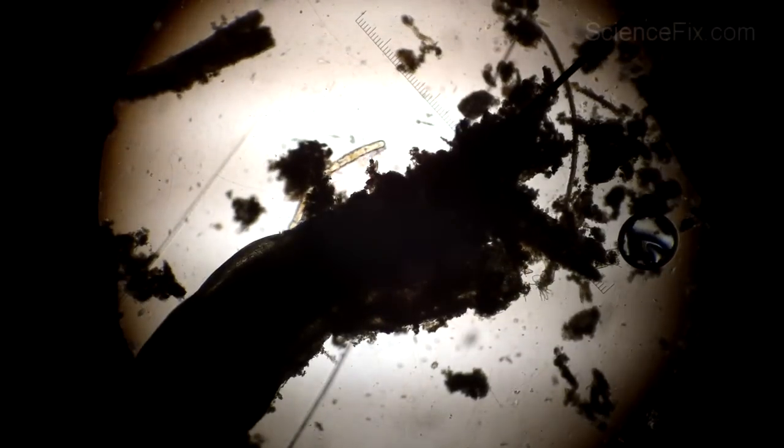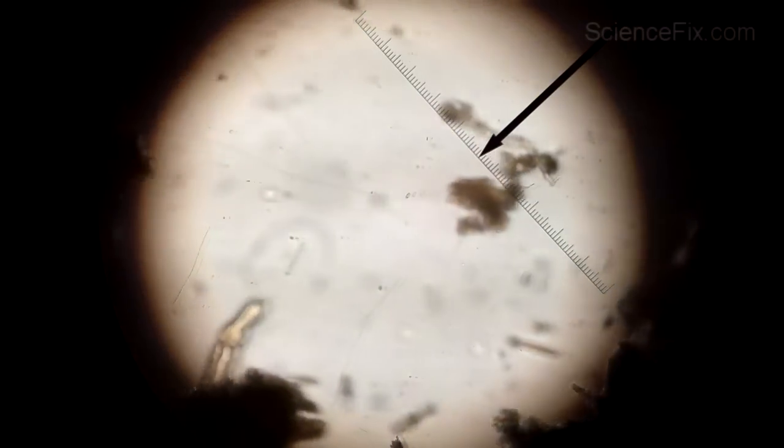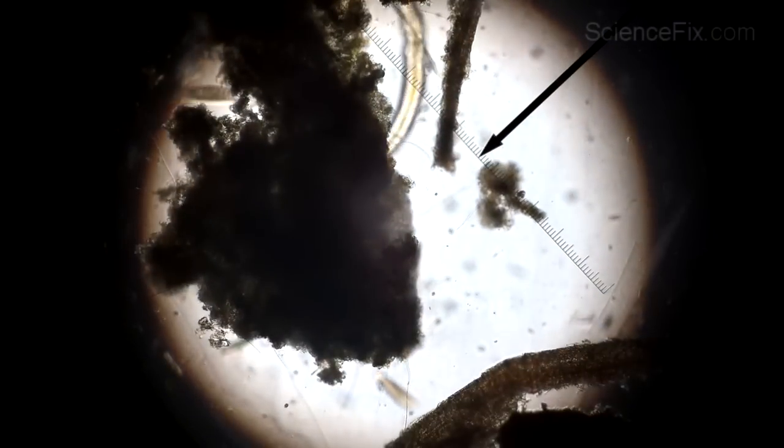Focusing on a drop of pond water is going to take you through various levels of that water — it's three-dimensional, it's not all flat. So here we've gone to a higher power and you can see this microorganism. You need a lot of skill to move that slide around to follow it. Students get really excited if they see something like this, and if they practice their skills they get really good at it.